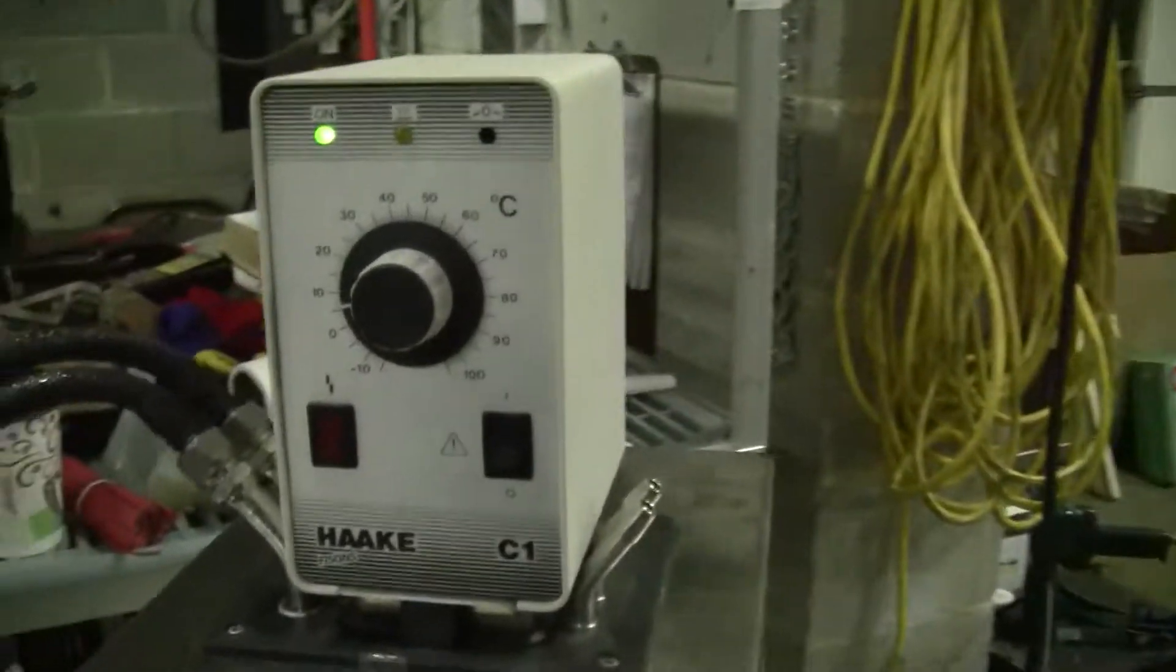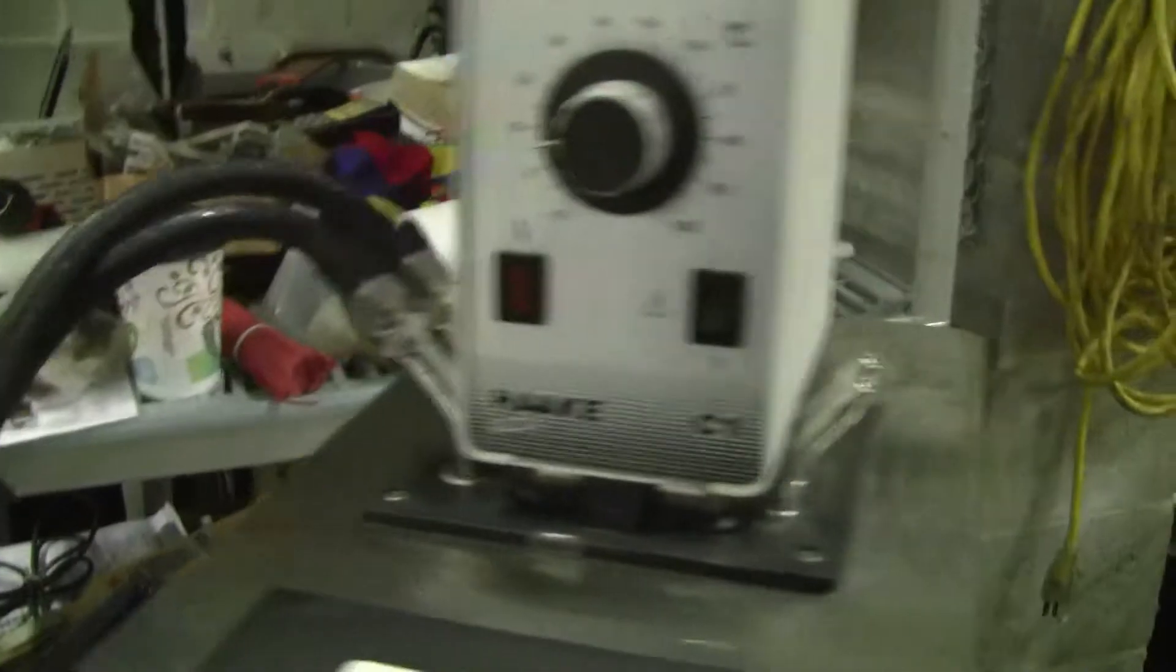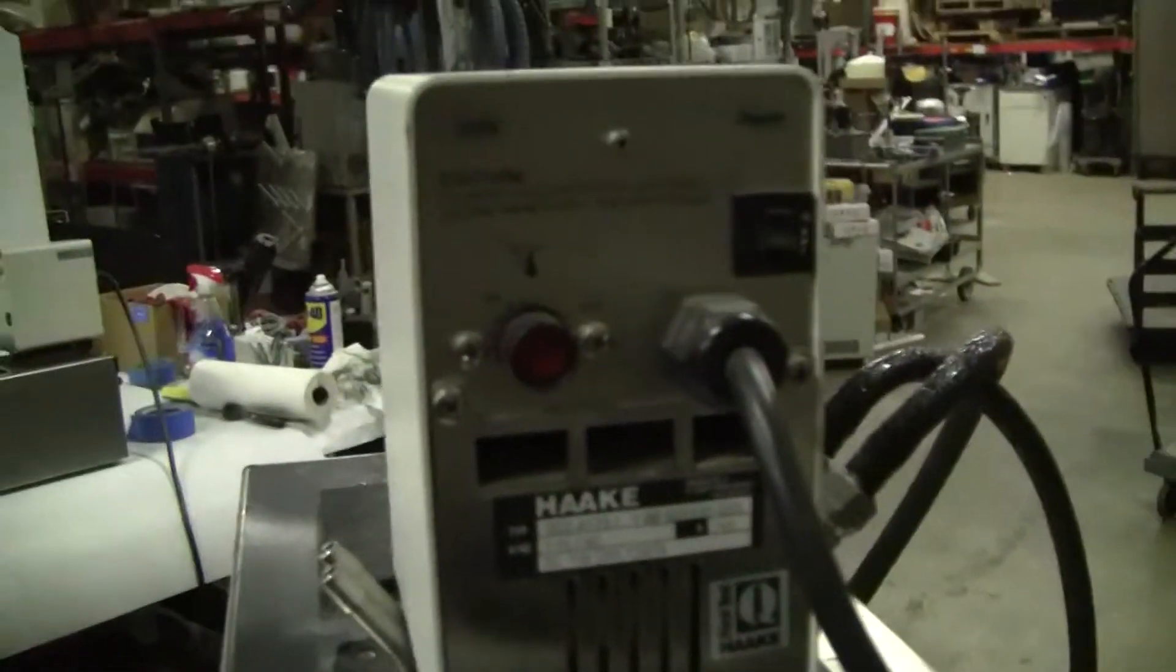This is an analog controller, in and out, external. Over temp is set in the back.